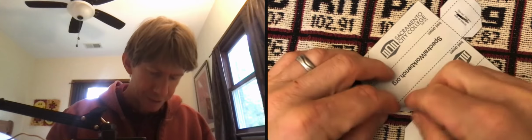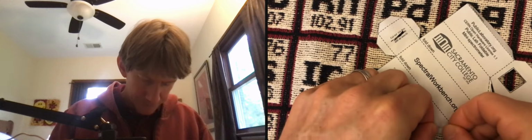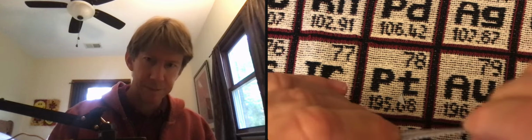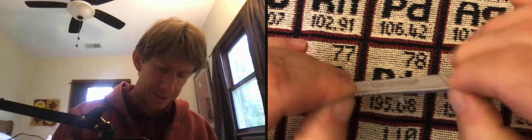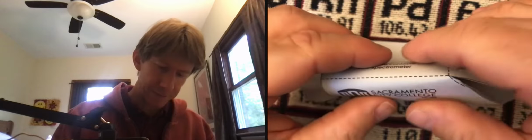That one should fold pretty well because it's a long one. It's bounded by a cut. And I mostly got it. Fold up. And I've got a fold down. And finally, these ones, I've got another fold down. Just sort of going along that, make it a nice crisp fold. There should be one more fold down here. Oh, it doesn't say it, but it's a fold down.